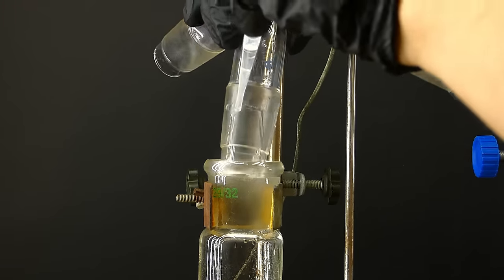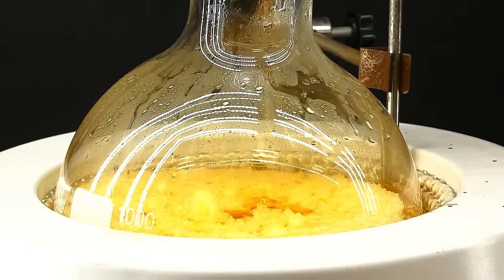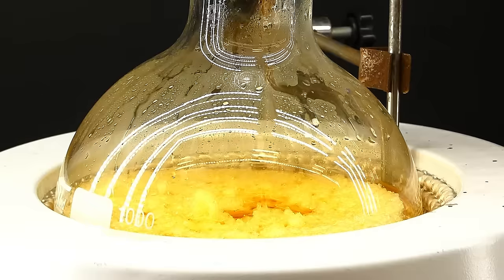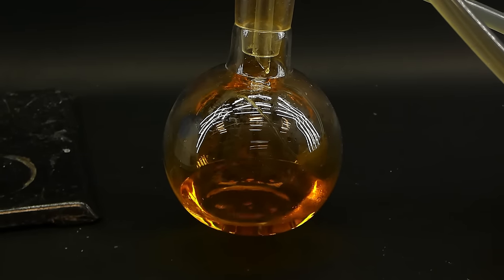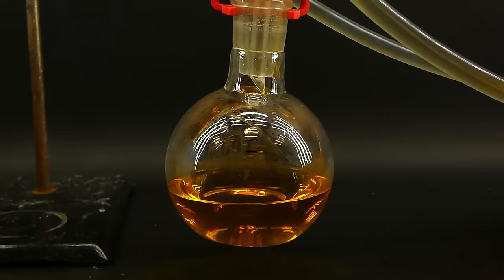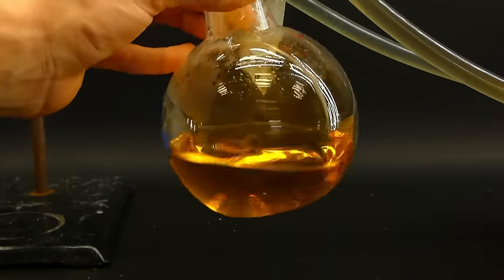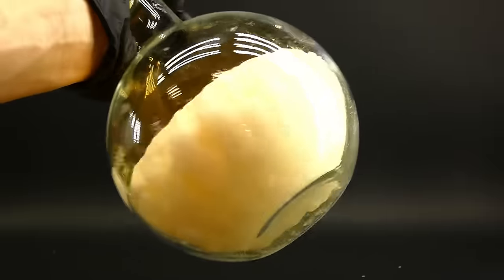To get it out of this mix, I set everything up for a simple distillation, and when assembling the apparatus, I greased every joint with some concentrated sulfuric acid, which is pretty much the only thing that can stop the ugly nitric acid vapors. I then started the distillation, and after a while, some yellow liquid started collecting in the receiving flask, which was now getting flooded with this scary dark orange gas, which is nitrogen dioxide, created by the breakdown of nitric acid. It is also rather toxic, so this procedure has to be carried out outside, or like in my case, in a fume hood. After a few hours, the acid stopped distilling over.